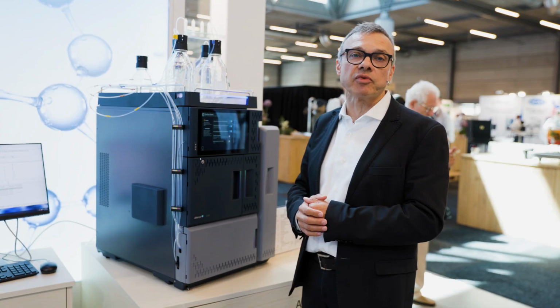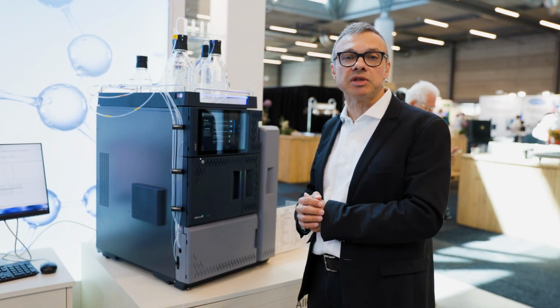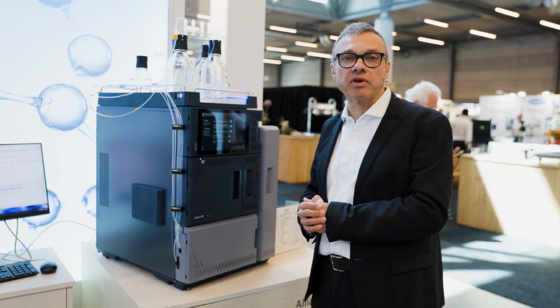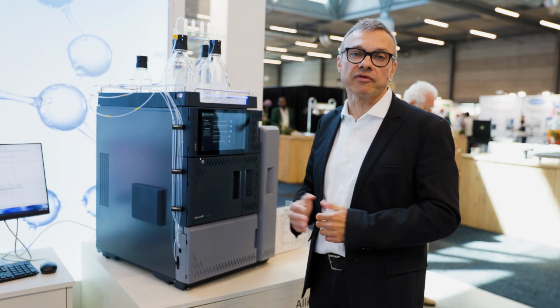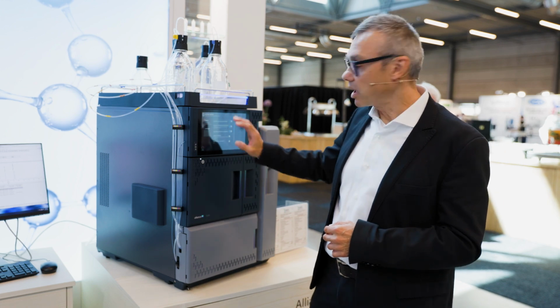And if it doesn't match, then it will stop the sample set from running, avoiding deviations and potentially out-of-spec results if any sample is then injected on the wrong column, with an investigation and wasted time in corrective and preventive actions. And this is such a time-consuming activity for a QC lab, also unplanned and triggering really high costs for the lab. So this is something that the system is helping us to avoid.